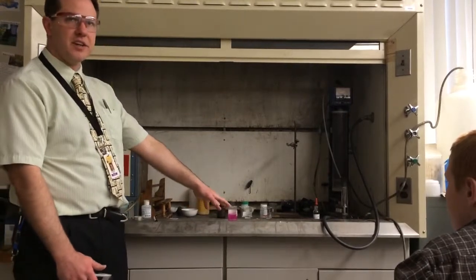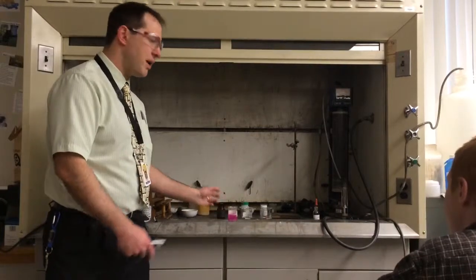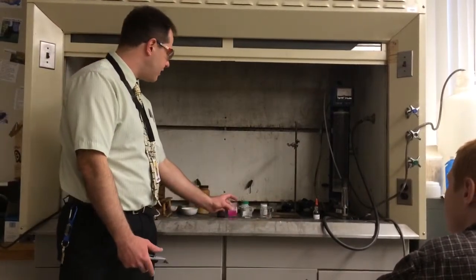So this is a quite violent reaction for water. Things don't usually react like this in water. Metals don't usually react like this in water, but these are the alkaline metals, they're very unstable.